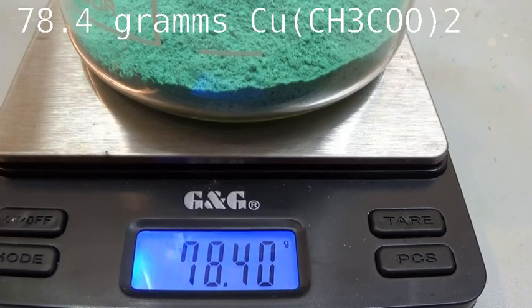The variation of colors of the crystals are due to the hydration grades. Mostly water-free copper acetate is greenish whereas the more hydrated forms are bluish. After admiring the crystals for a while I crushed them down to get 78.4 grams of copper acetate with unknown hydration grade.